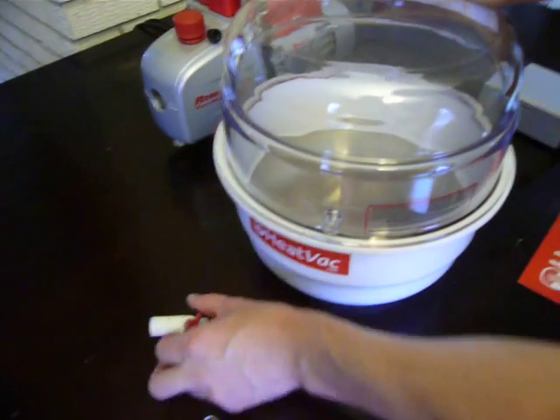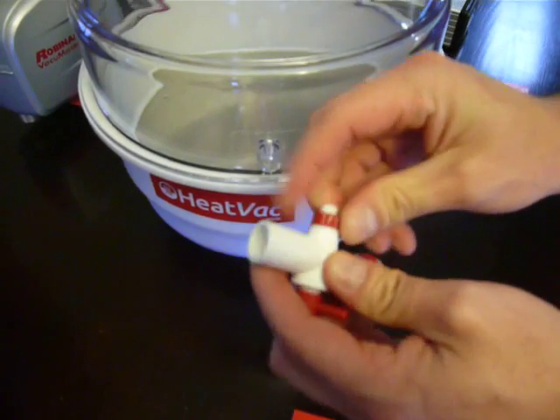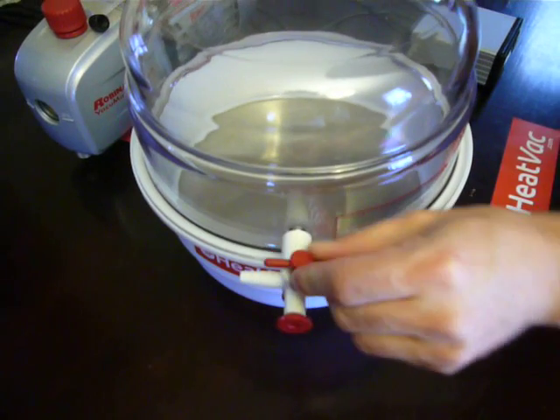Here's the port. This is a three-way stopcock. Make sure the nut here — the red nut — is tight, but don't over-tighten it. It doesn't need to be tightened very hard. Go ahead and put that on here and you'll be able to see.